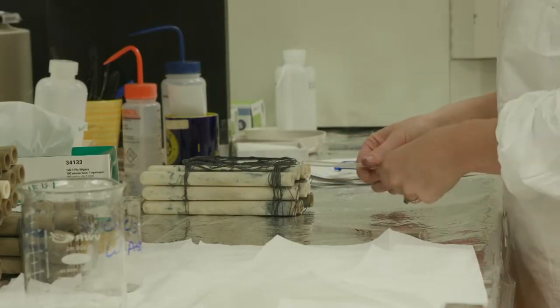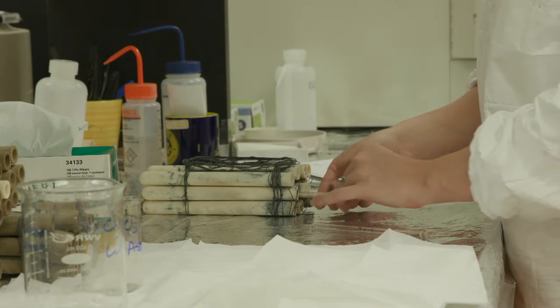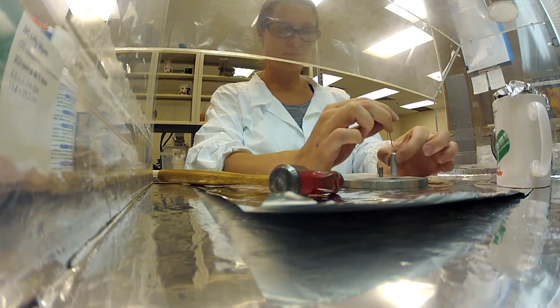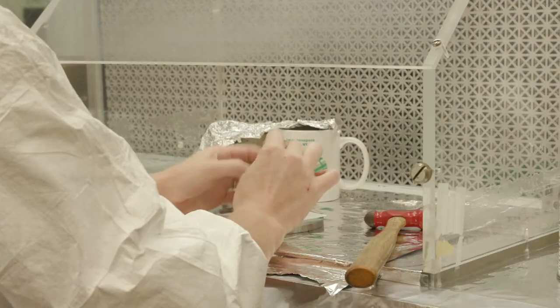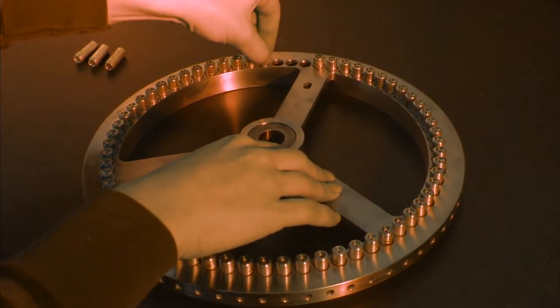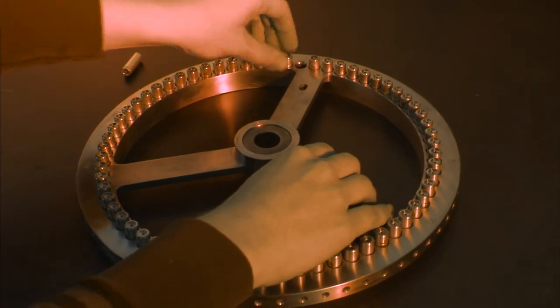The CO2 produced from the combustion is what we reduce to graphite. In putting the samples into our ion source, we place them into small sample holders — basically aluminum or stainless steel cartridges with a small hole in the front into which we mount our sample. We then take those cartridges and put them in a larger stainless steel wheel that holds up to 64 of them. Inside the ion source, a rotating mechanism allows us to go to any one of those 64 samples, push it up into the ion source where we make our measurement, then retract it, rotate the wheel, and load another sample.